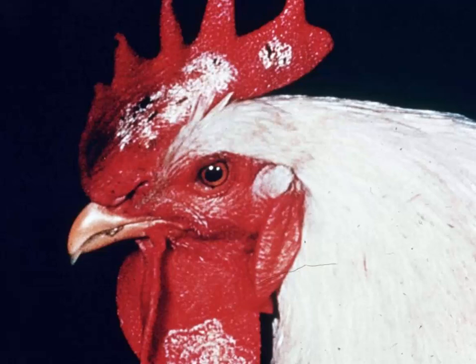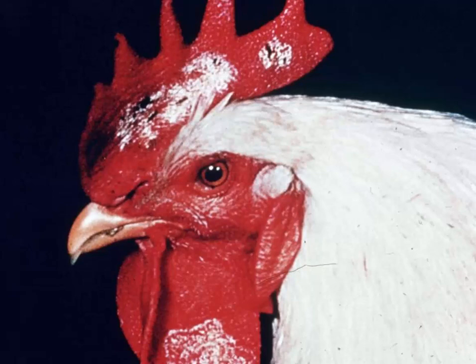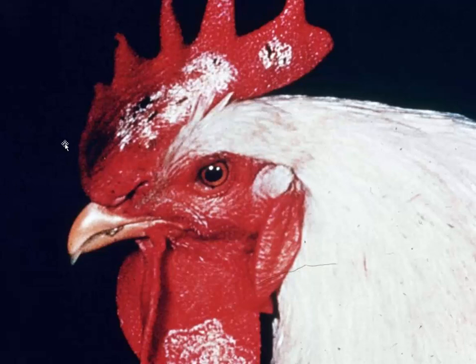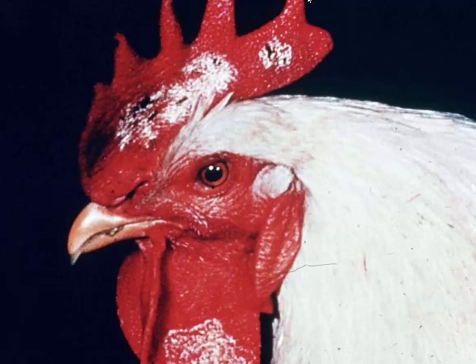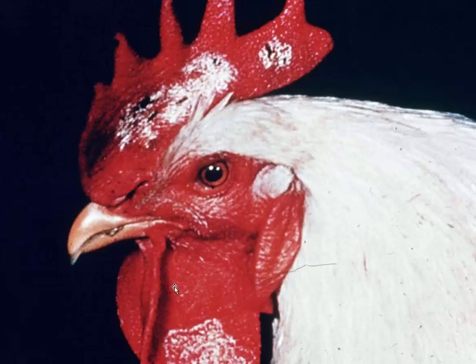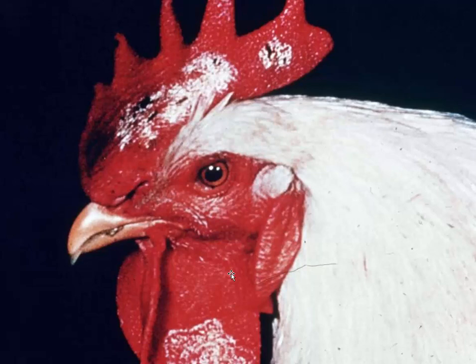Here's our last slide for today. Slide number 10 is from a chicken. Can you give me a morphologic diagnosis and name the condition? This is multifocal hyperkeratotic and proliferative dermatitis — to be complete: hyperkeratotic and proliferative dermatitis of the comb and wattles. If you see hyperkeratotic dermatitis in just about any other species, you're going to think about dermatophytosis, and chickens get dermatophytosis as well. The disease name in chickens is favus, F-A-V-U-S — very similar to what we see in other species with dermatophytosis.